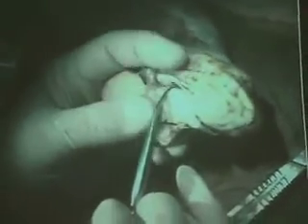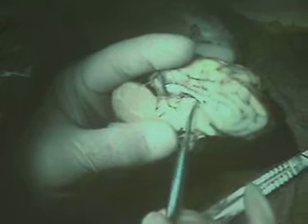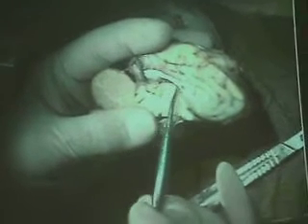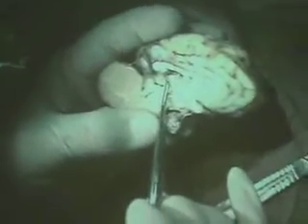Right below that, here's another ventricle. The next ventricle is called the third ventricle, because you have two lateral ventricles, one on each side. It is this space plus this region right here, the region that's formed when these two sides come together. And you can see that knot of capillaries here. You see it? So this is the third ventricle, this area and this area here.